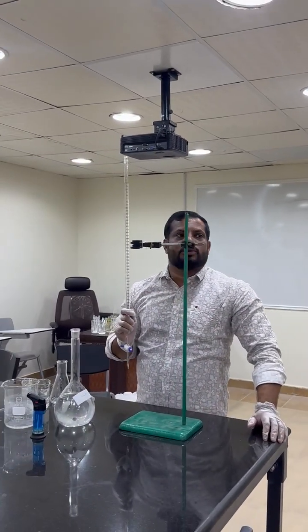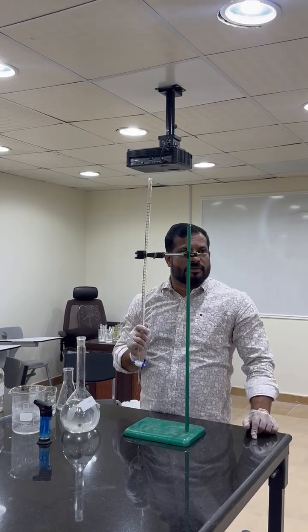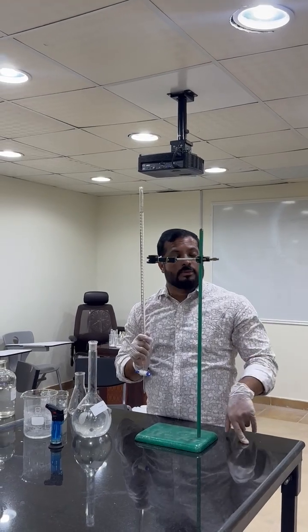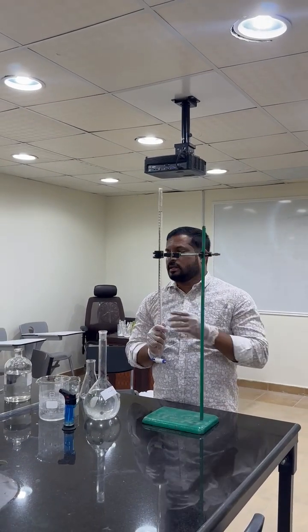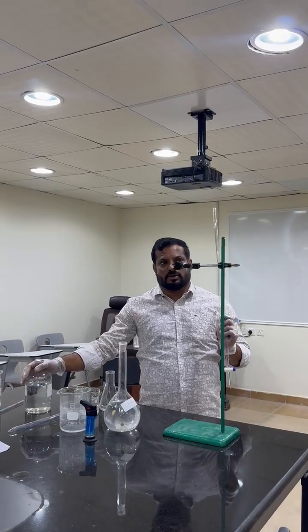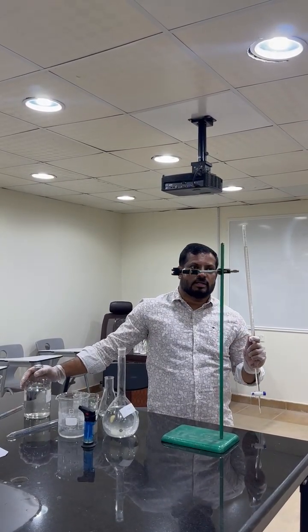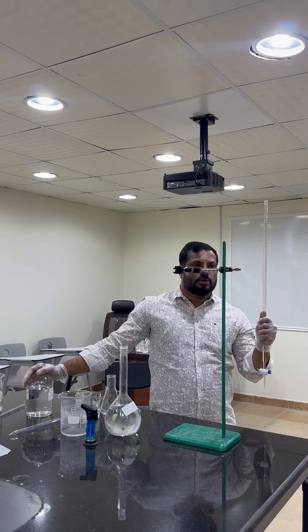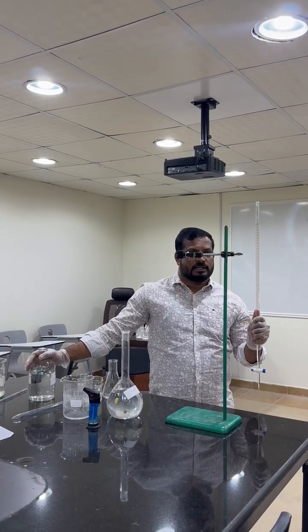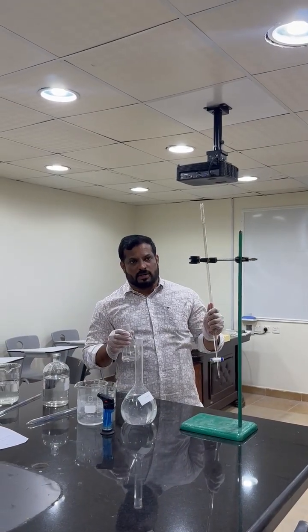Then you want to use the formula N1V1 equals N2V2. Concentration of HCl multiplied with the volume of HCl equals the concentration of sodium hydroxide multiplied by its volume. The volume you know — you took 1.8 ml, that is V1. V2 is 25 ml sodium hydroxide.